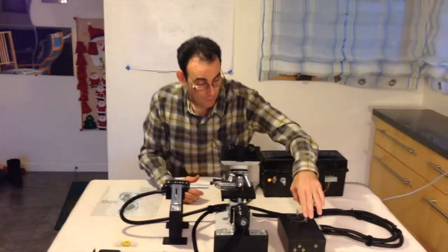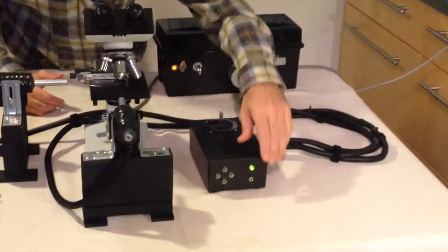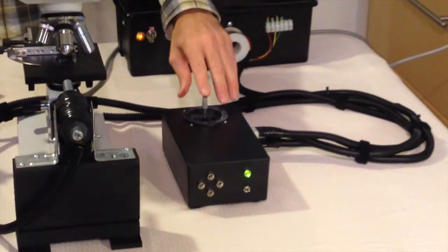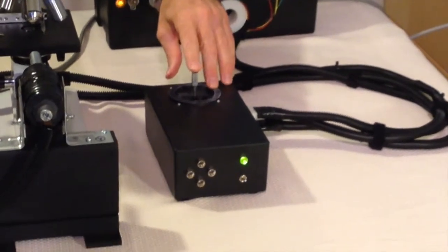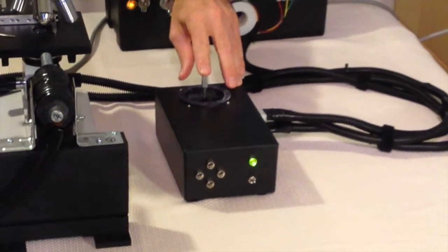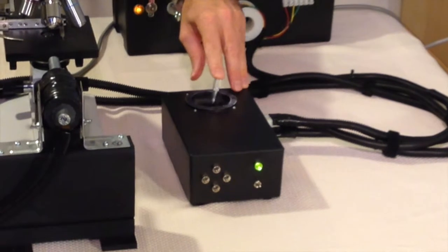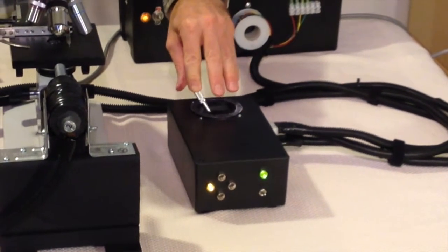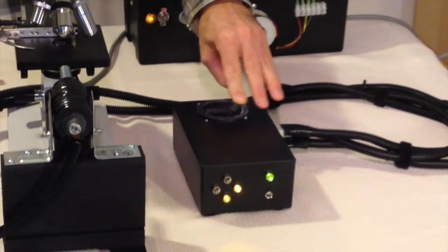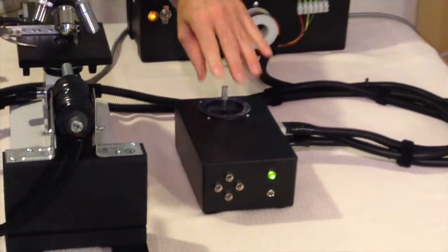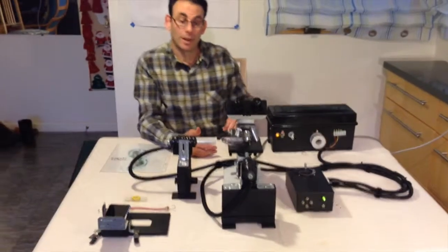The way we have it hooked up, we can point the magnetic field anywhere in 2D. As we move the joystick around, we can change the magnetic field and move the bacteria.